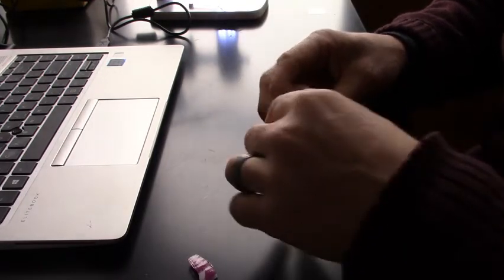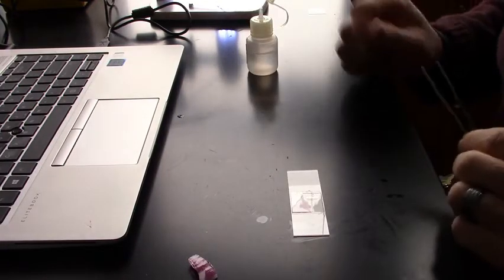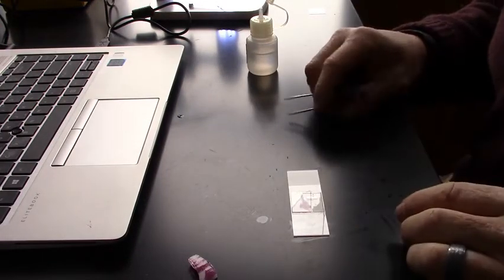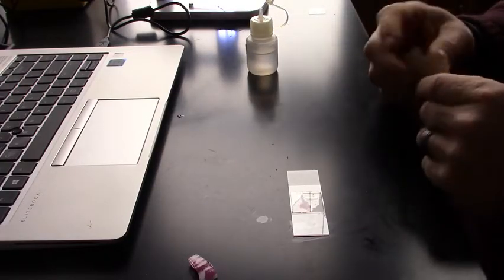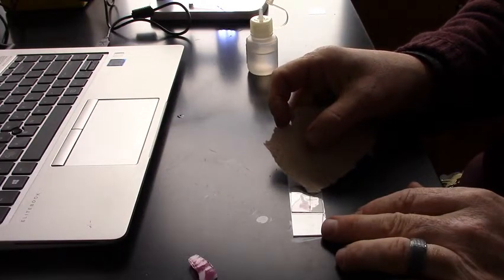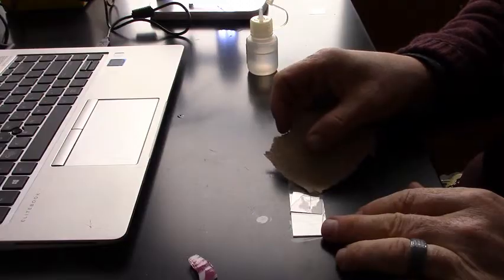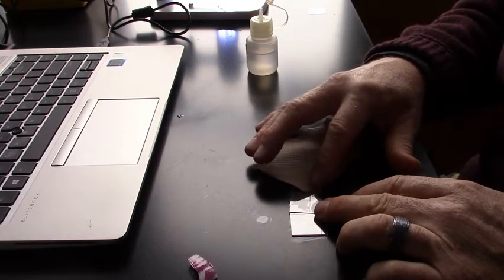Now I'm adding a little bit more water, but what I'm eventually going to do is slip a little paper towel underneath the cover slip, and that's going to draw water across that cover slip across that slide and allow me to replace that tap water with salt water. So I have a salt water solution that I'm going to grab in just a second.